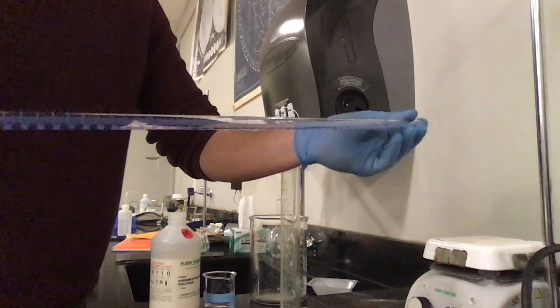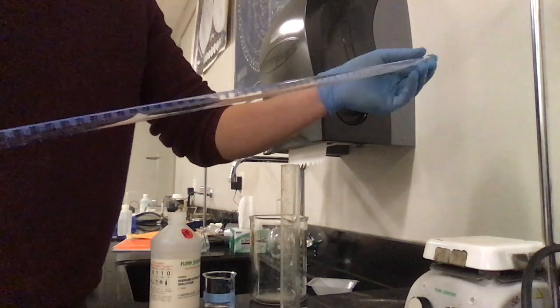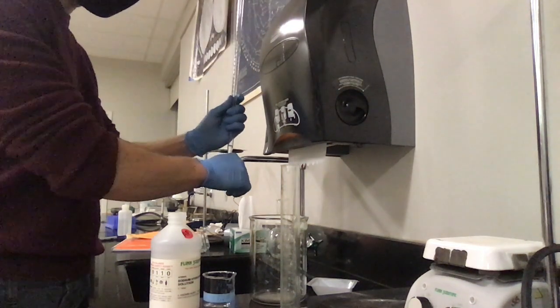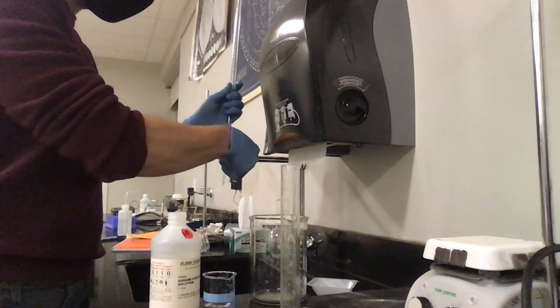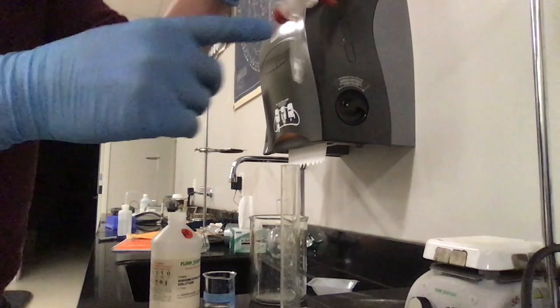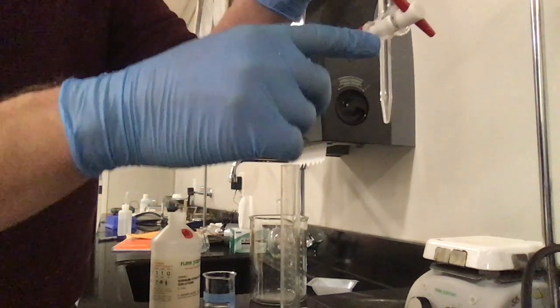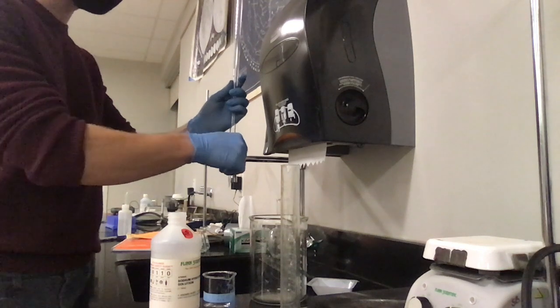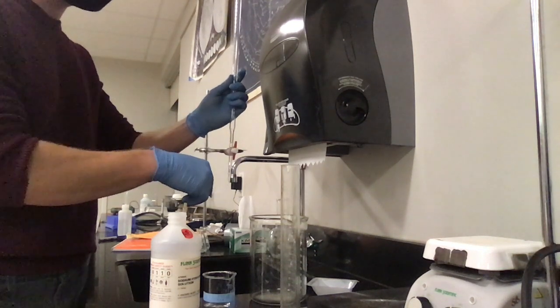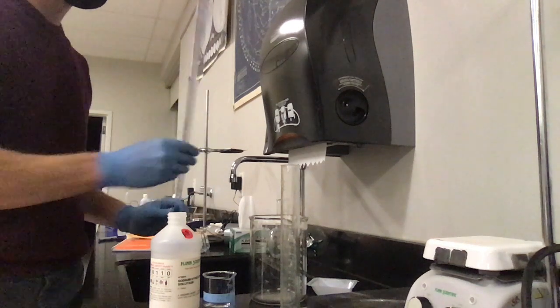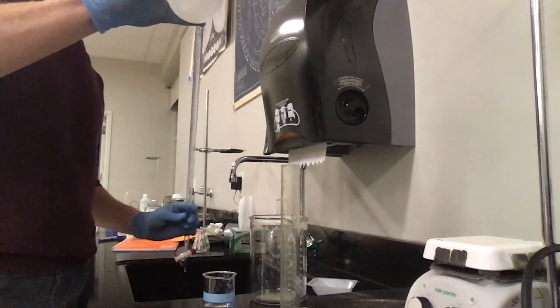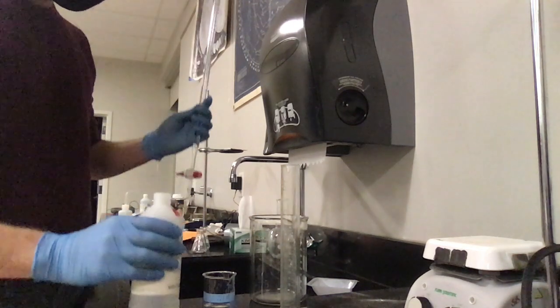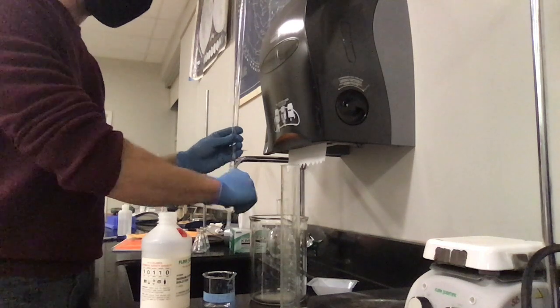And what that does is it makes sure that any solution that might've been in this apparatus beforehand should be now replaced by my sodium hydroxide. I then allow that to flow out. It gives me the added benefit of giving me some amount of volume in this bottom here. I'm actually going to, because this one I know was dirty, I'm going to let a little bit more out until I'm totally empty and I'm going to refill it and do the same thing again. First time using this in a while.